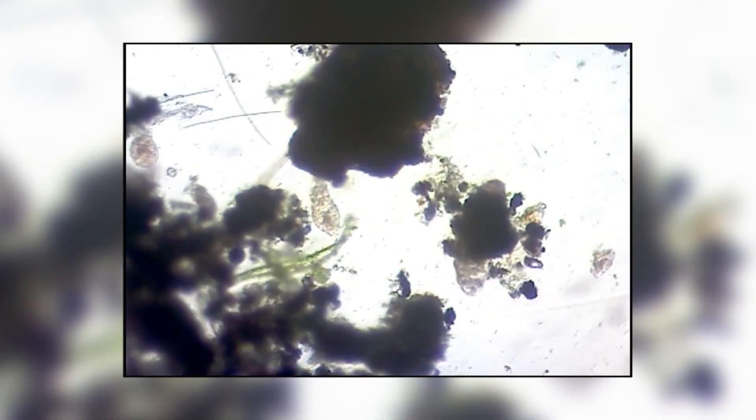Tardigrades - they're cute, they're tiny, and they're pretty tough. These eight-legged animals can survive almost anything and live almost everywhere, and today I'm gonna show you how to find them.